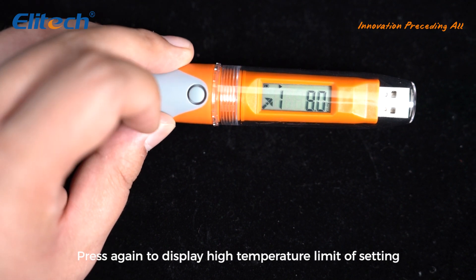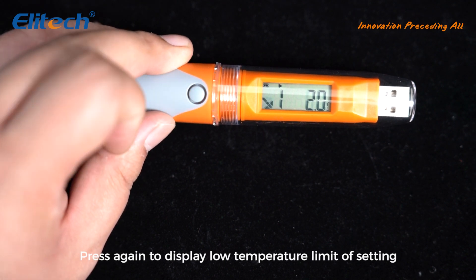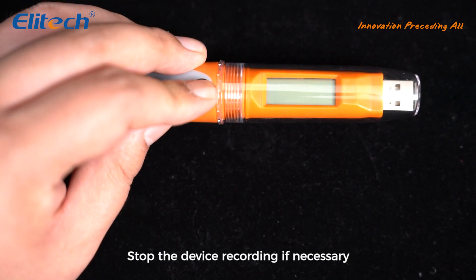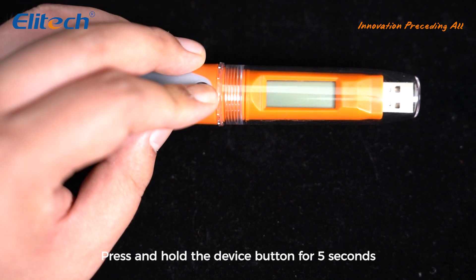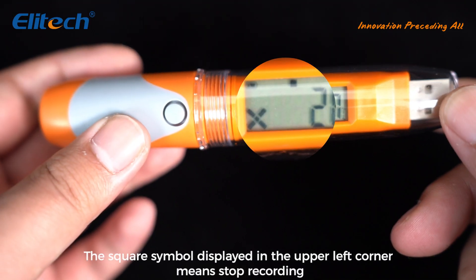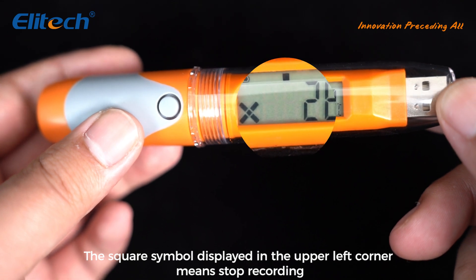Press the button again to display the maximum temperature of the stored data, then press again to display the lowest temperature of the stored data. Press again to display the high temperature limit setting, and press again to display the low temperature limit setting. To stop recording, press and hold the device button for five seconds — the square symbol in the upper left corner means recording has stopped.